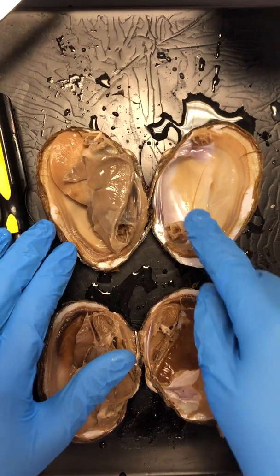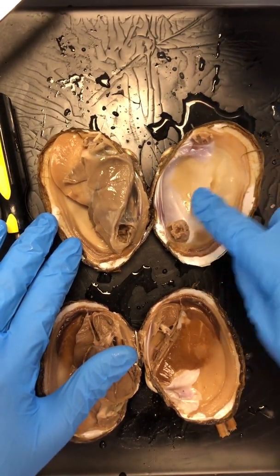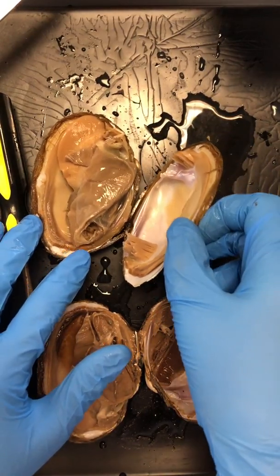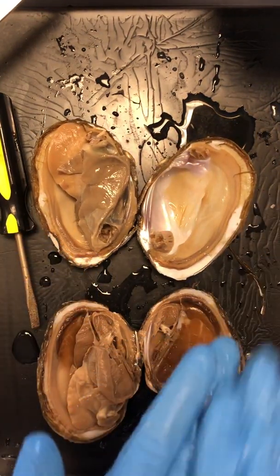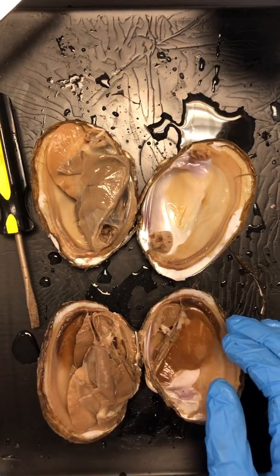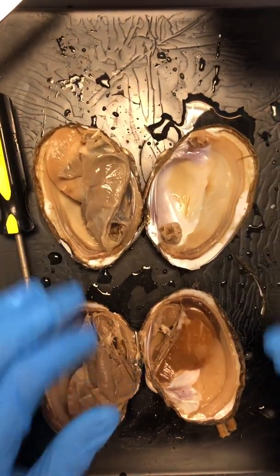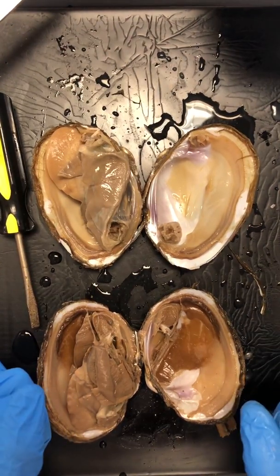When we're specifically looking at our bivalves, what we care about is this inner layer of the shell. Not this squishy stuff right here, but this shiny hard part. It kind of looks like a pearl, if you will. That's called your nacreous layer. Your nacreous layer is this shiny interior layer of your shell. It's formed first. So that nacreous layer forms, and then there's another layer, and then your hard outer shell. That's the part that pearls are made out of, if you want to be fancy.